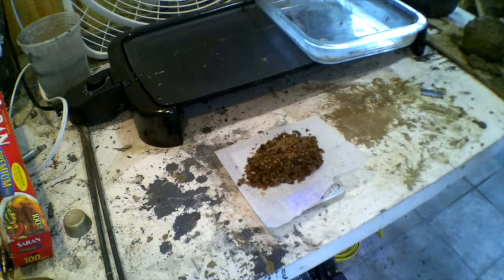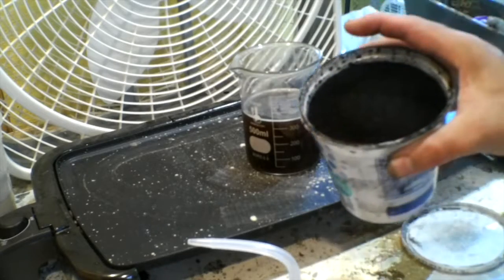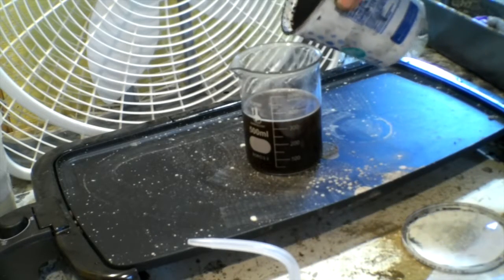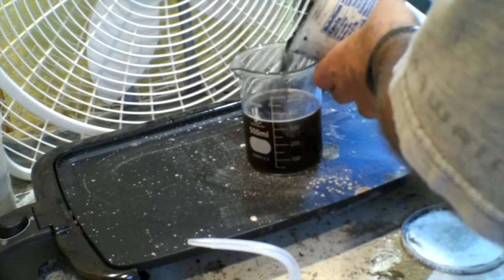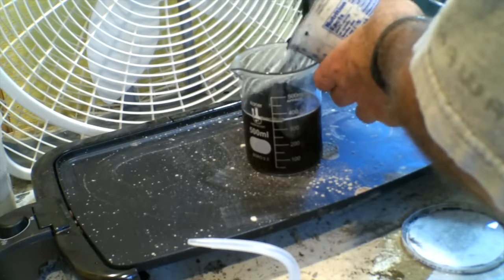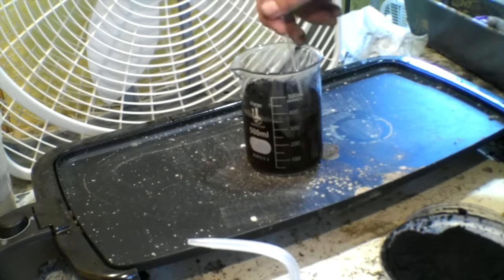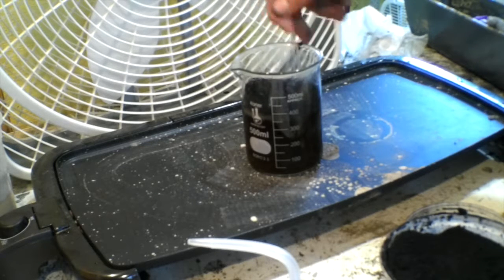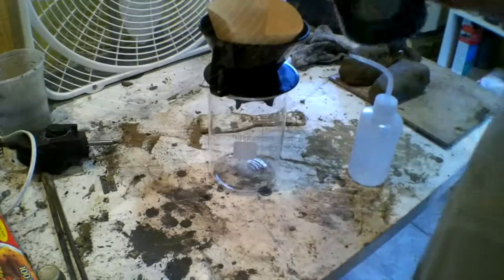I am going to try cleaning it up. What I'm going to do is add some of this truly lovely powdered charcoal that I made in the ball mill. I don't have any activated carbon, but I've got this. So I'll just put some of that in there, stir it around and let it react for a bit, and see if it will absorb that color, and then I'll filter it off.